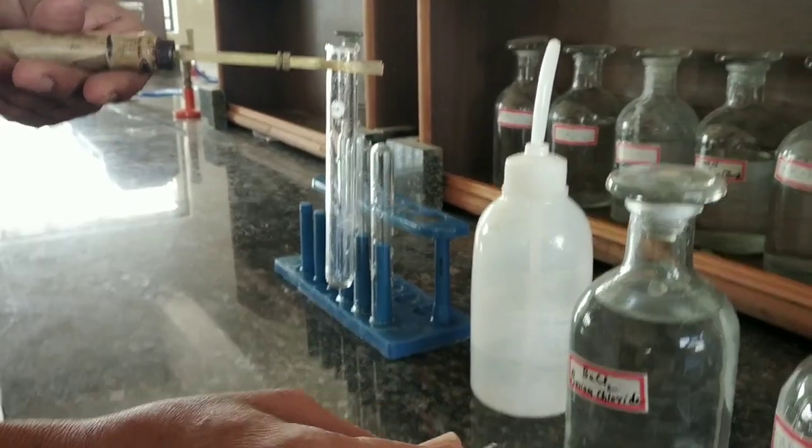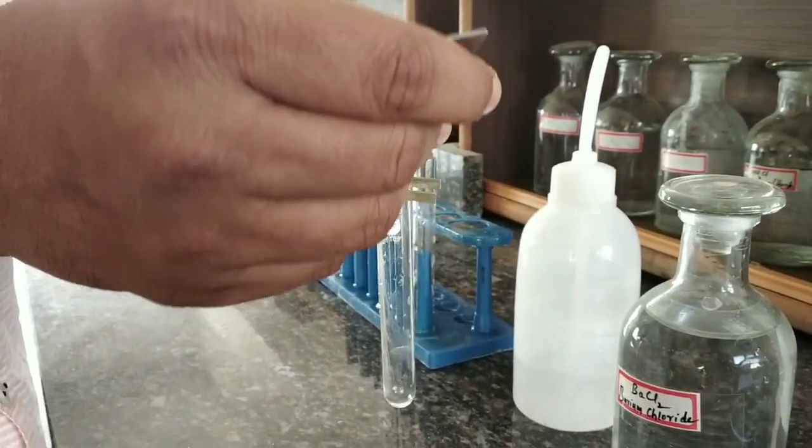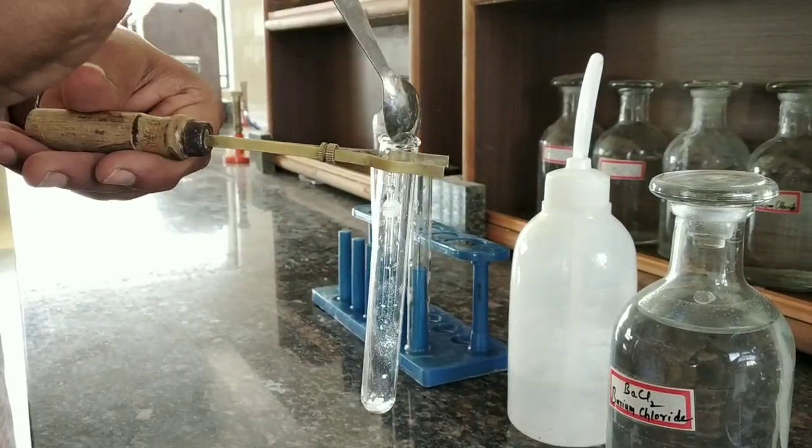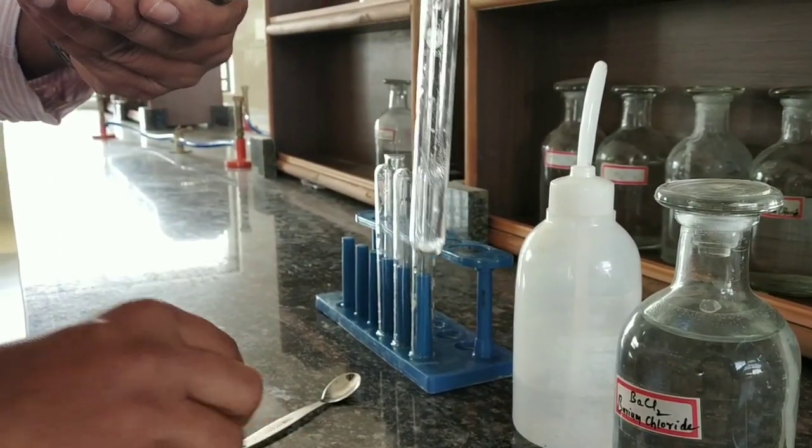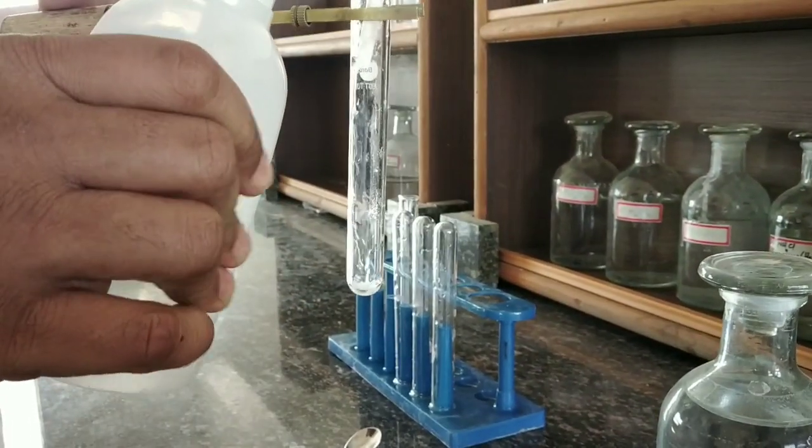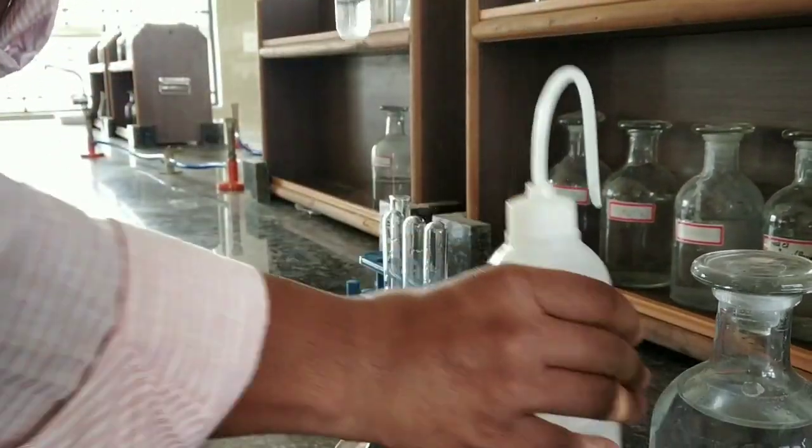Then we can go for confirmatory test for sulfate ion. Take a pinch of salt into a clean test tube and make it a solution, which becomes salt solution.